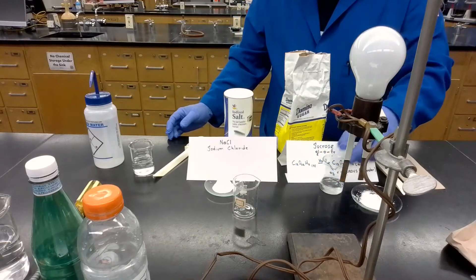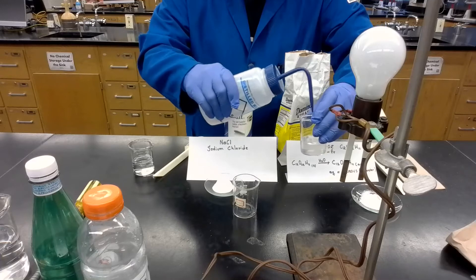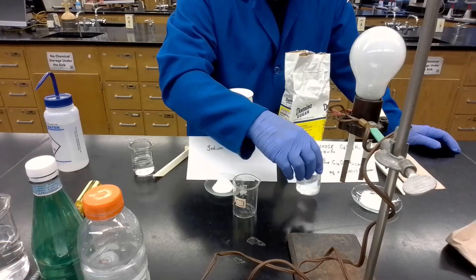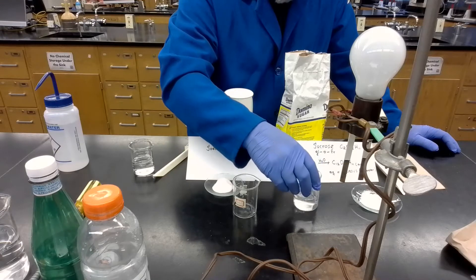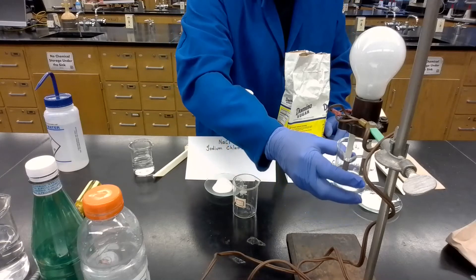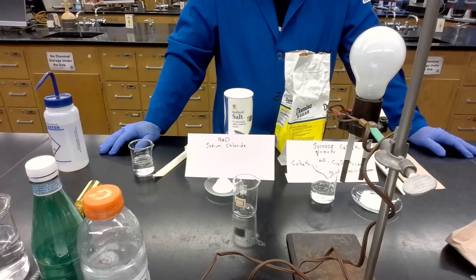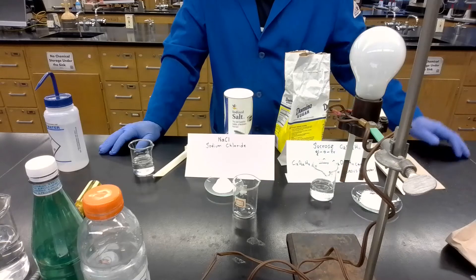In this case, we call this a solution — a homogeneous mixture, no phases, no solid phase in the solution. I have now completely dissolved the sugar into the water. Let's test again — nothing. So we can conclude that the aqueous solution of sugar does not conduct electricity. Therefore, we can say that this solution is a non-electrolyte.